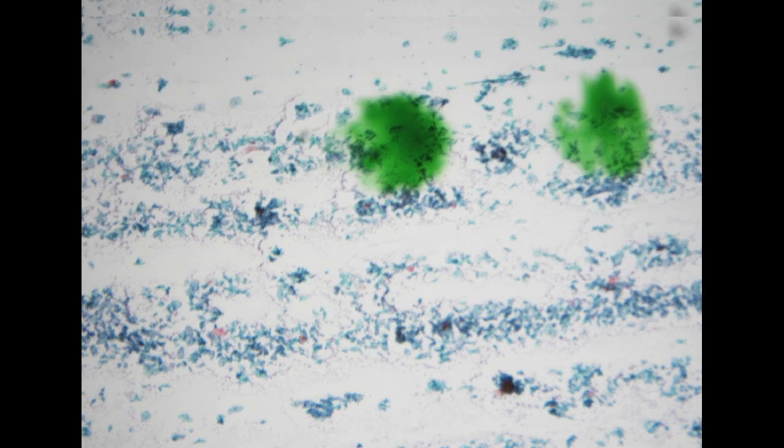However, I think she came to our hospital because of a positive pap smear at the outside hospital, which suggests that there was a CIN3 lesion. So we realized that for this patient, she had already received total hysterectomy, so there should usually be no endocervical cells, no glandular cells in the pap smear.